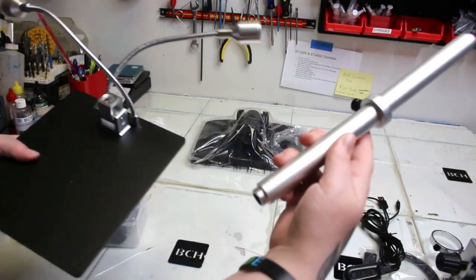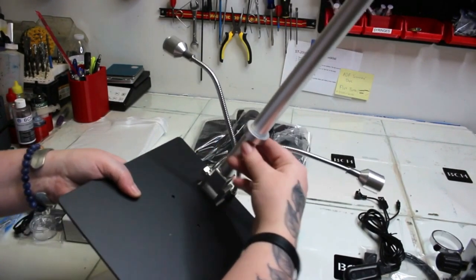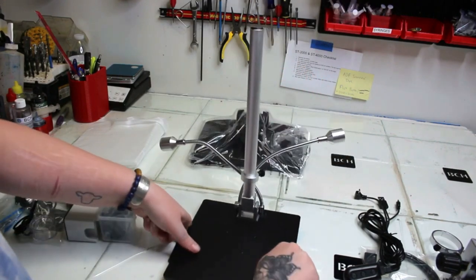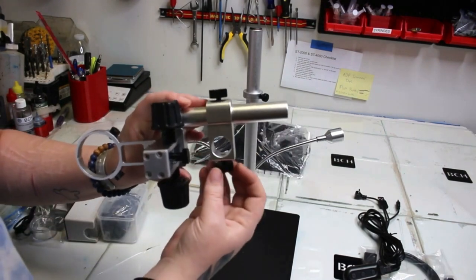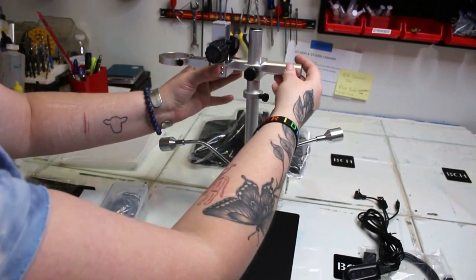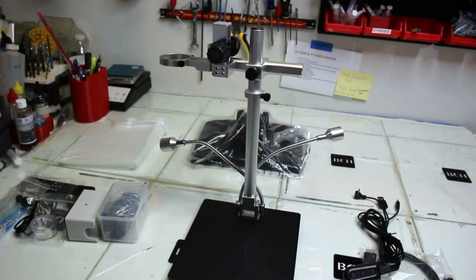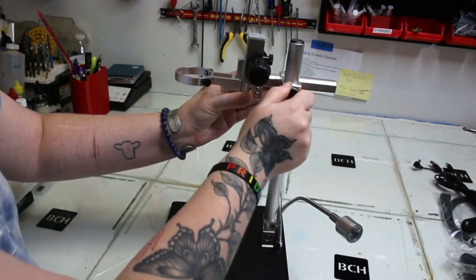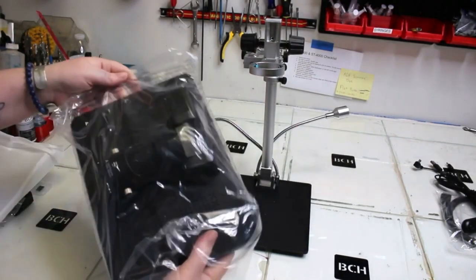We'll use that long rod — you'll see there's a screwed part at the bottom, and that's where we want to screw it into the base. There's that loose lock ring — the loose circle on top. That part is going to stop how far your microscope can go down if you lower it by the knobs. Here's the boom arm — I'm putting that over the top, and now I'm tightening the screws. It was facing the wrong way, so I loosened it and twisted it around so it's now hovering over the base.